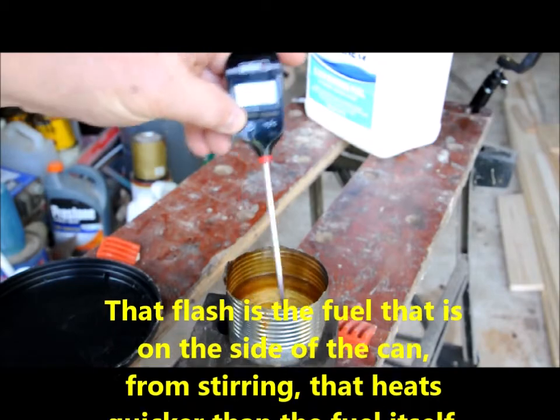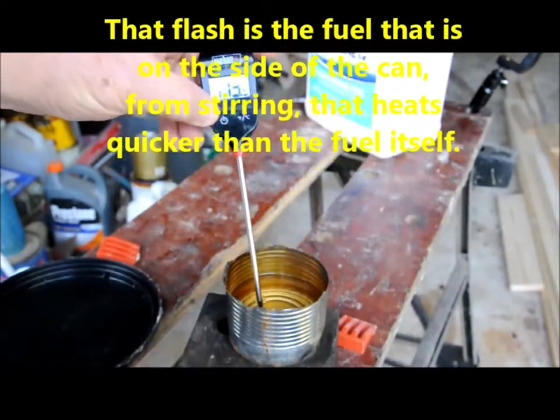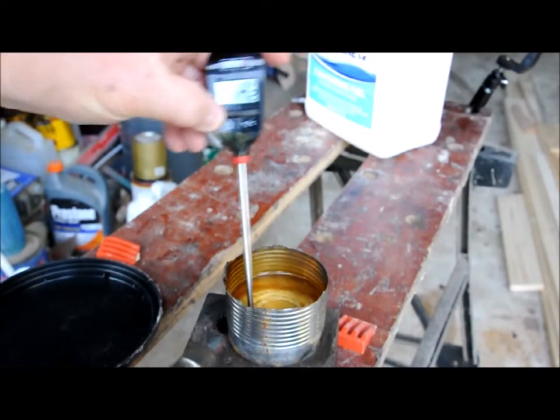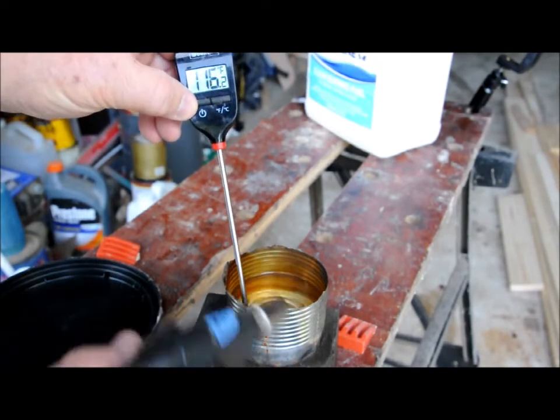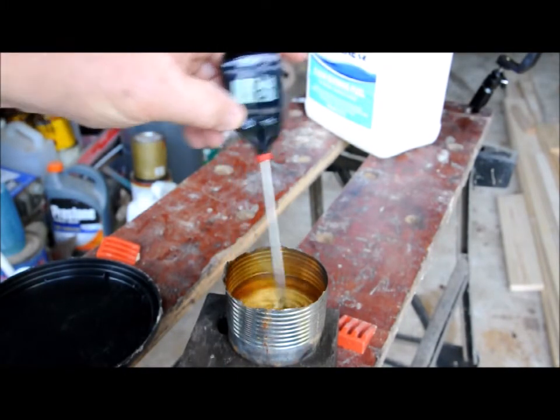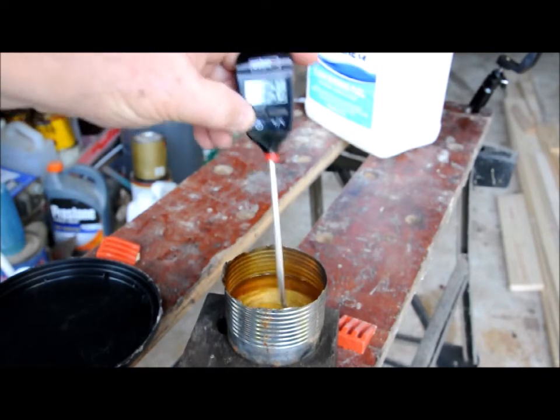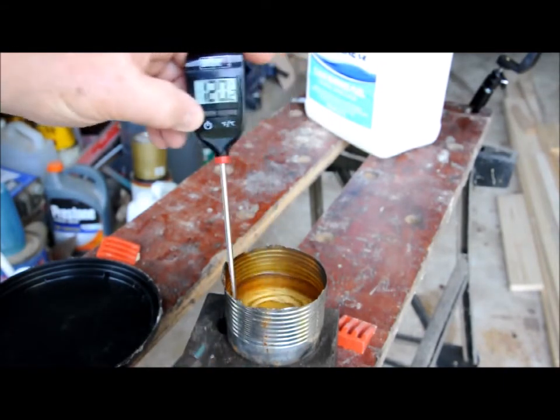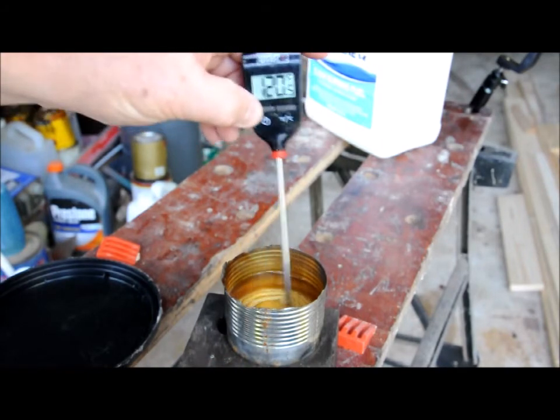We had a little bit of a flash there at 112 degrees. Did you see that? I don't know if you can see it, but it's not sustaining. 114, 115 degrees — we get a little bit of a flash. 118 degrees. Slight flash.